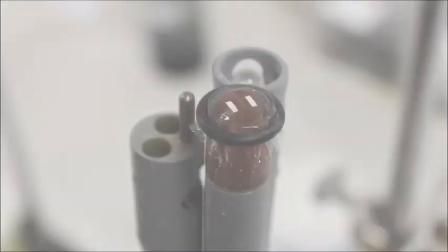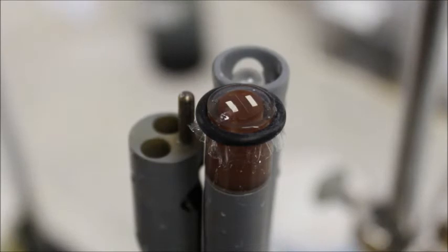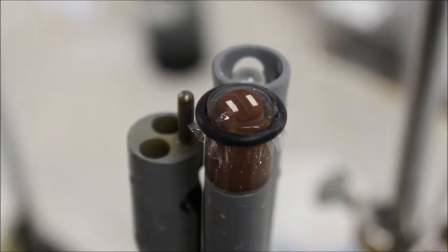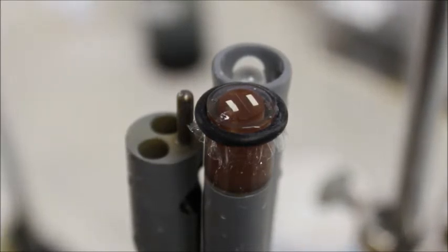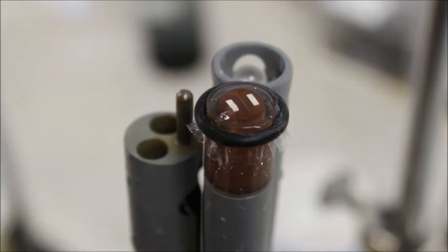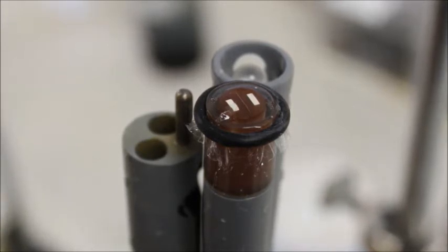When calibrating any instrument that has multiple probes, it's important to remember that readings from one probe may affect the readings obtained from the other probes. Many times, we'll notice that the DO probe is not working correctly, which also affects pH readings.